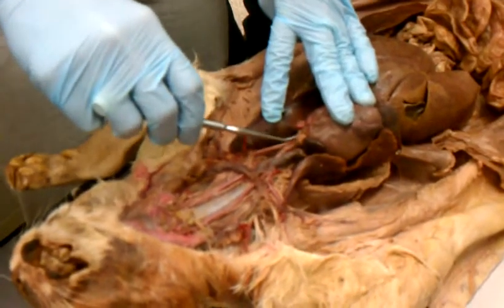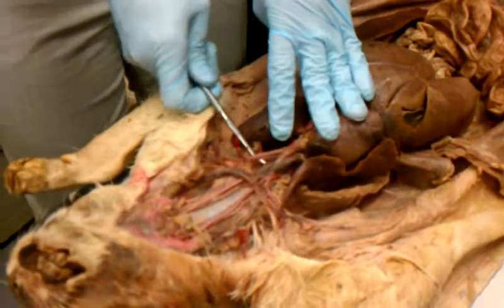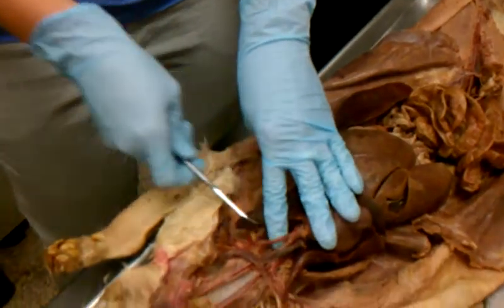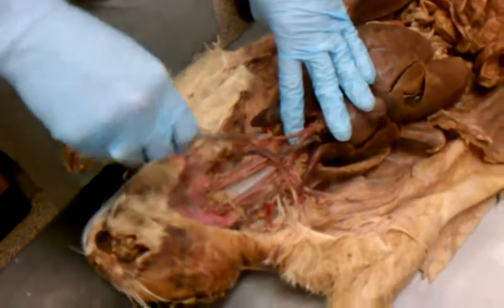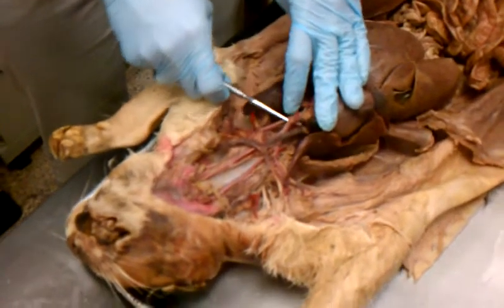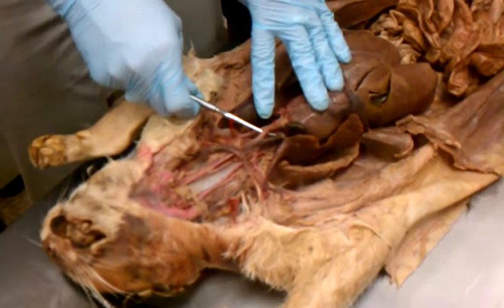So, in review, we have the aorta, which curves around the heart. Where it curves, it's the aortic arch. Comes up, you have this first left branch. First left branch is which one? Left what? Subclavian. It goes under the clavicle. So left subclavian artery. And then it's this big old one on the right, which is the what?